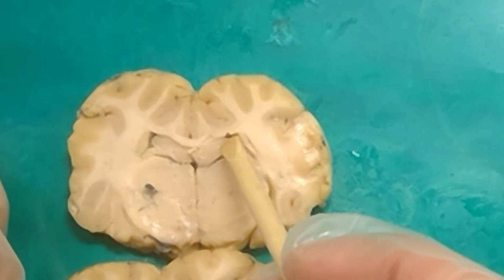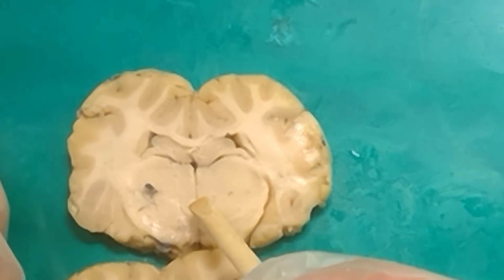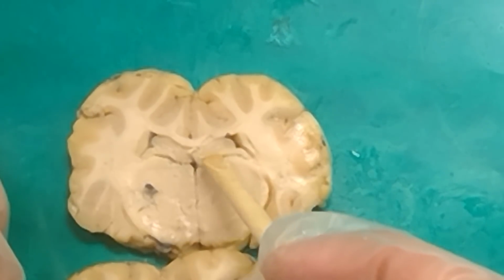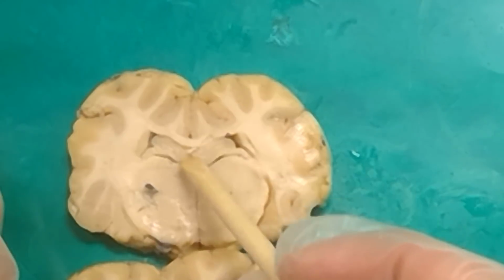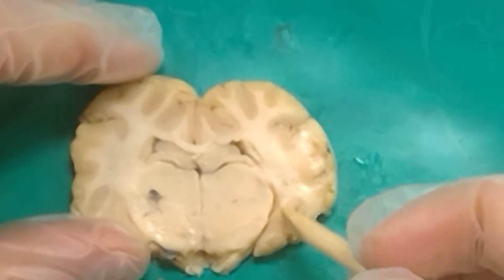And if you're able to look at it just right, there's a swirl in it, which if I were to open a neuroscience themed amusement park, I would name my roller coaster the hippocampus and would totally have loop-de-loops on it. But so you've got that.